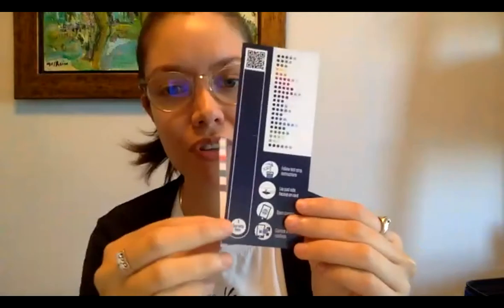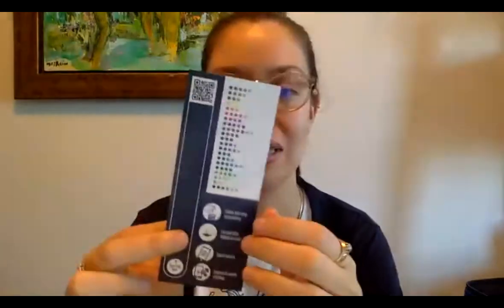And I mentioned this study that we're doing with these test strips. If you don't have somebody to help you validate your results, or if you just want to make sure that your results are good, then in your mini test kits, I'm pretty sure Kat included these with yours. Yeah, okay, I see a head shake. So you have this reference card. What this reference card does is help this machine learning algorithm we have read the values on your test strip. This is kind of in beta mode, so we're just launching it in a couple weeks. It might be a little difficult at the beginning, but the more people use it, test it and give us feedback, the better it's going to get.